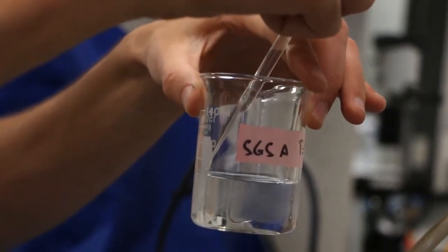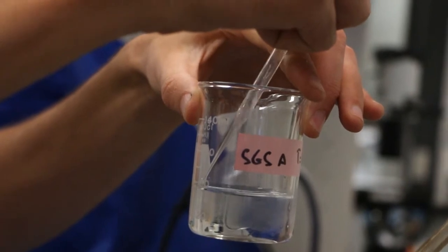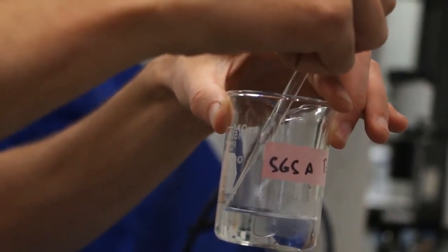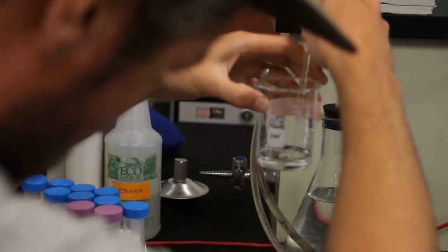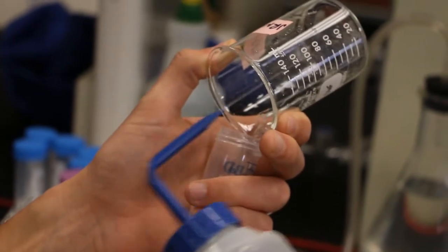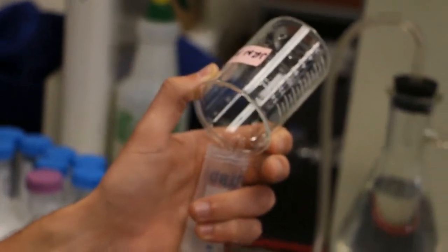This sample went through three collection cycles, but we don't want that much water. So let the nematodes settle for a few hours in the beaker, and then siphon off an amount that can fit in a watch glass to look under a microscope. Always remember to rinse out your beaker to collect any stragglers that might be left behind.